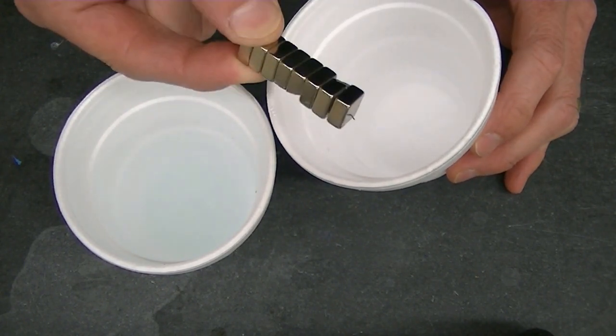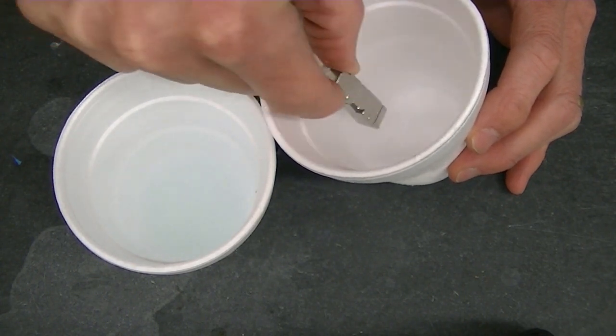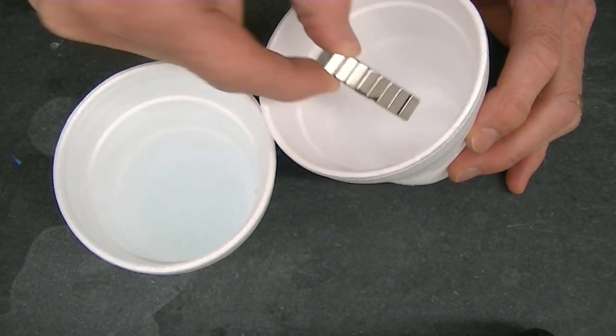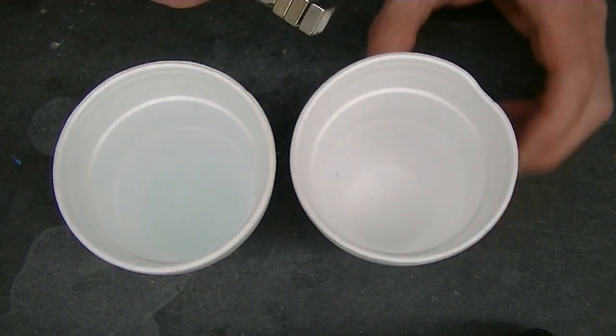And it doesn't look like any of the liquid is attracted to the magnet. Try it a couple more times here. I don't see any evidence of magnetic attraction.